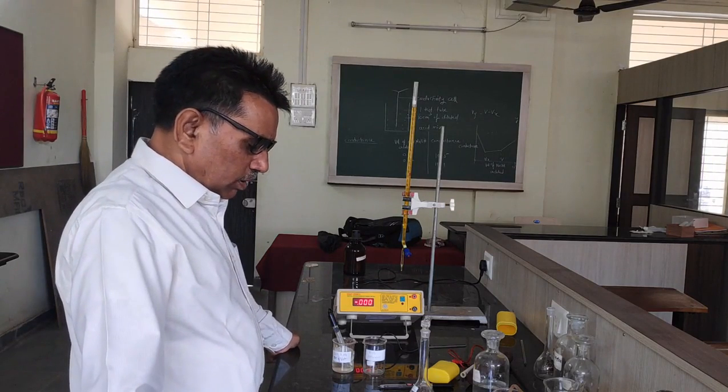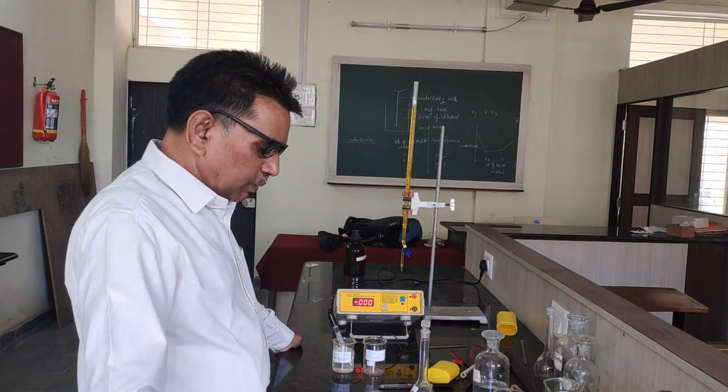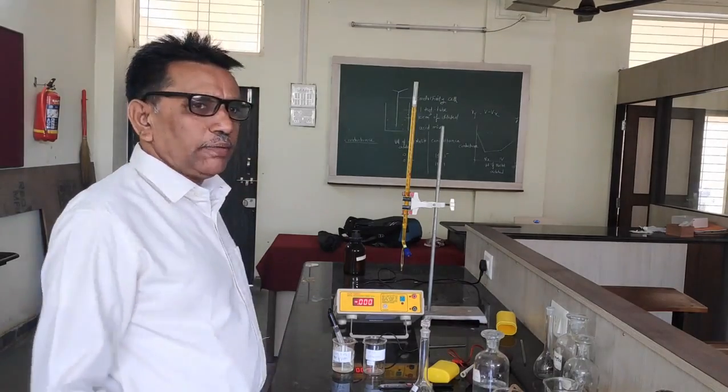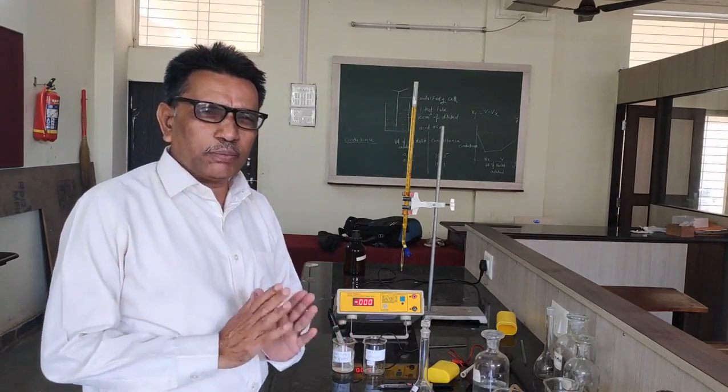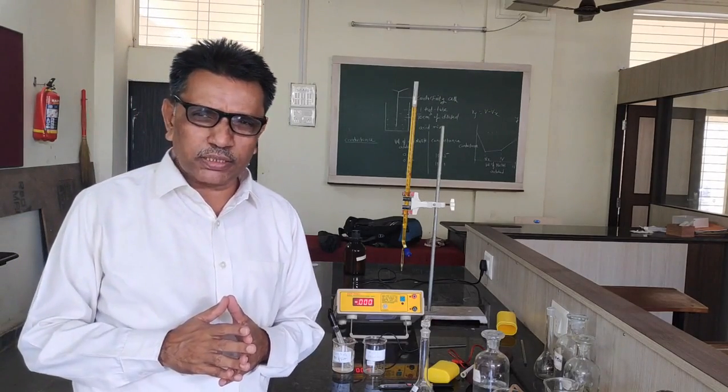So in this lecture, I would like to perform an experiment belonging to potentiometry. In the syllabus of the T.Y.B.Sc., there are two potentiometry experiments.